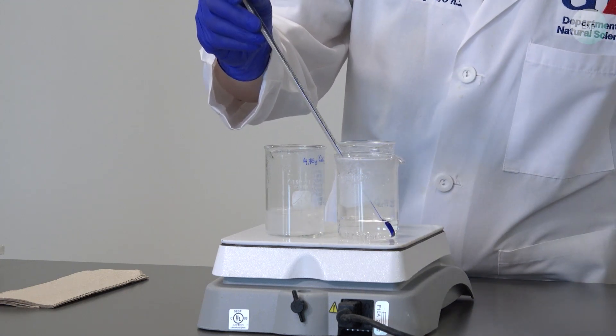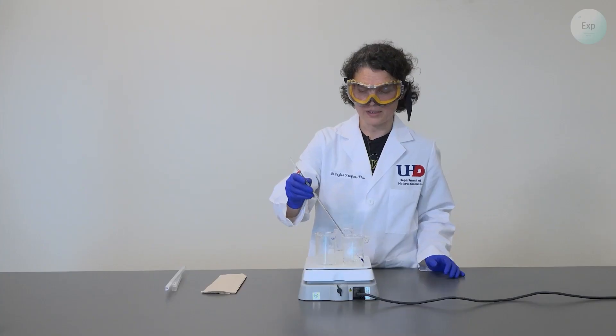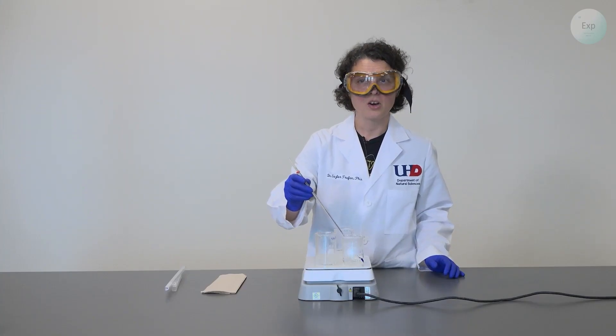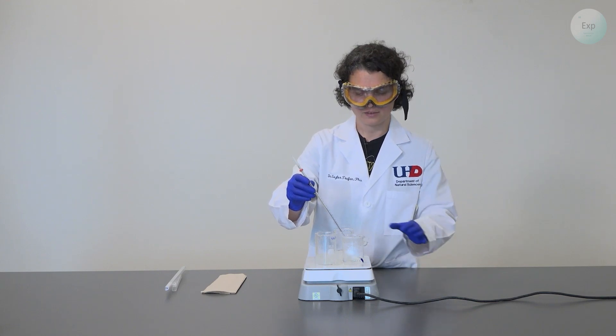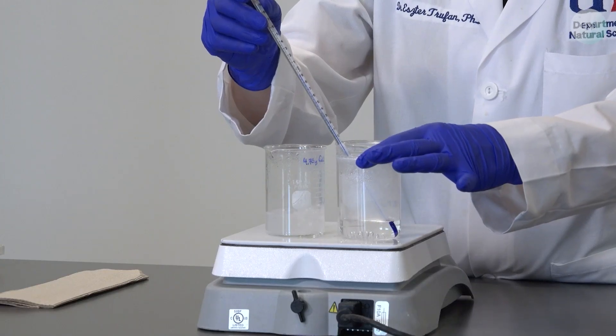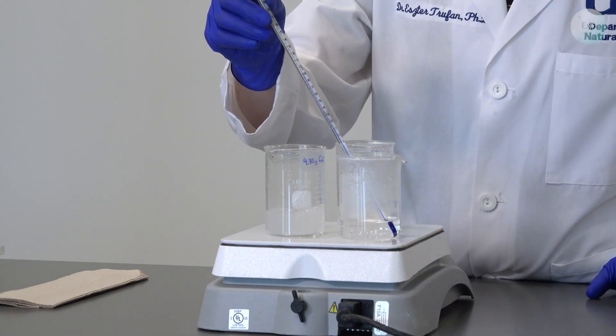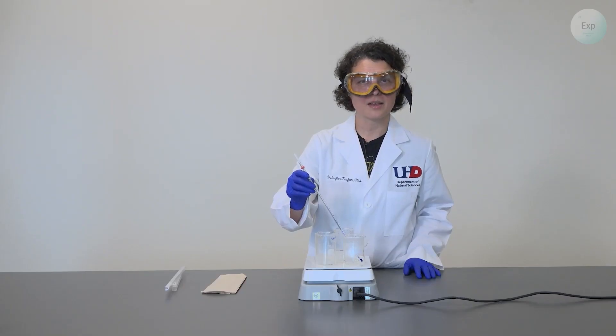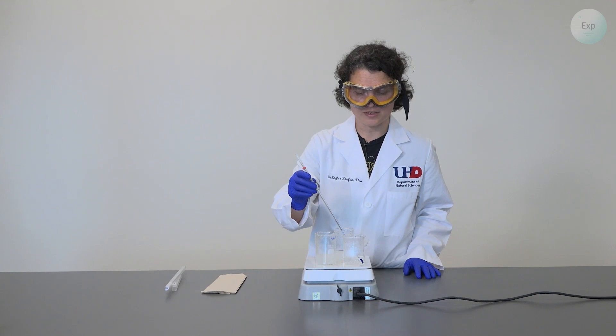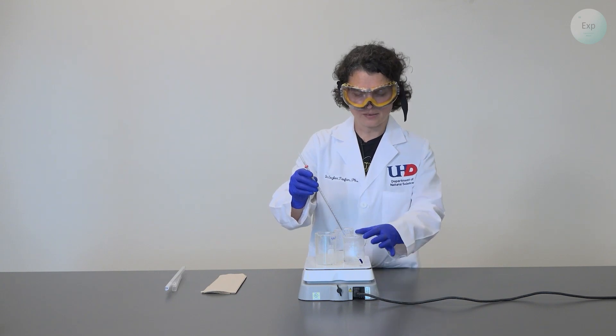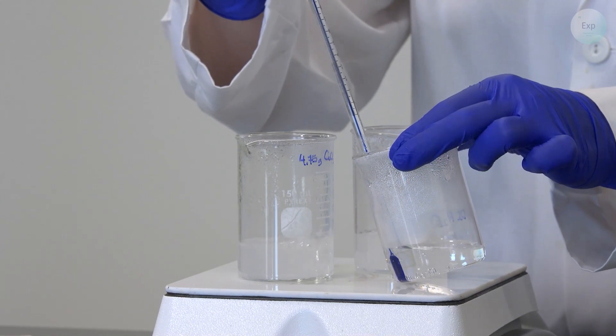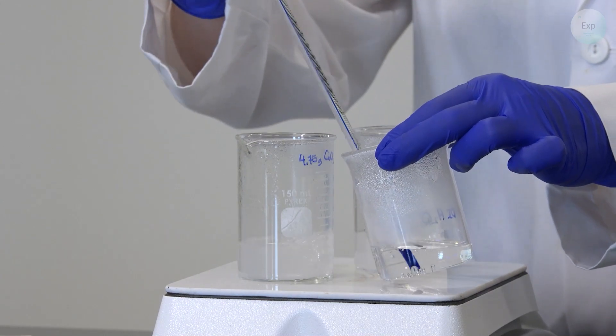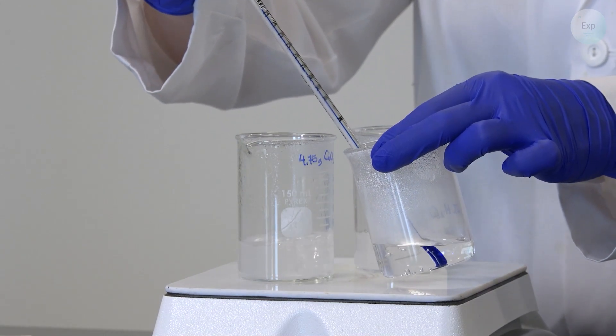Be mindful that these beakers that have the boiling water and boiling calcium chloride solutions in them are very hot. So at this point if you are not very careful with them they may easily burn your fingers. You may use tongs to elevate them just slightly for the purposes of your temperature measurement but as the top of your beakers is quite cool compared to the bottom of the beaker you may be able to lift it up carefully.